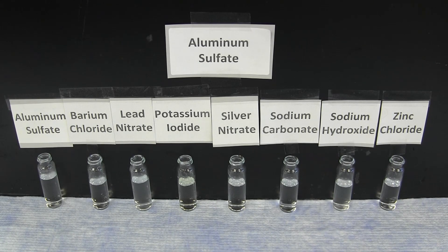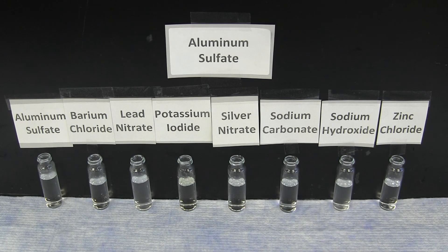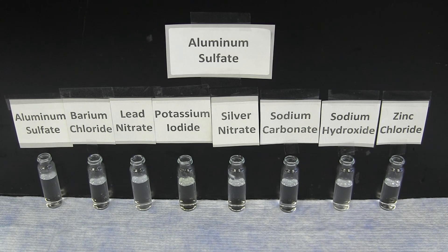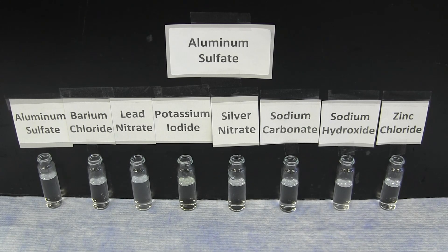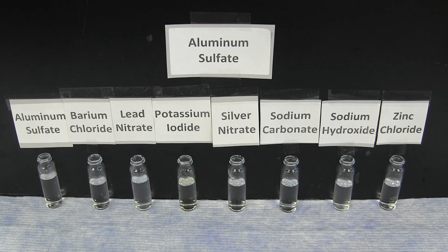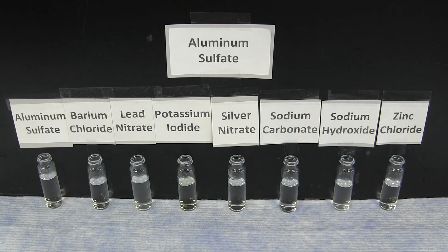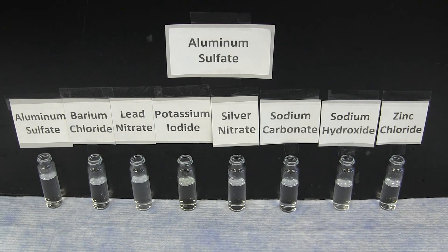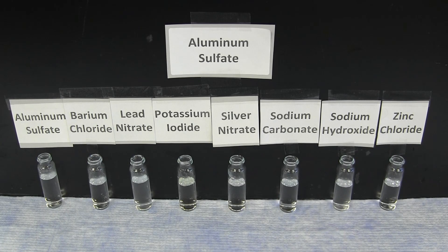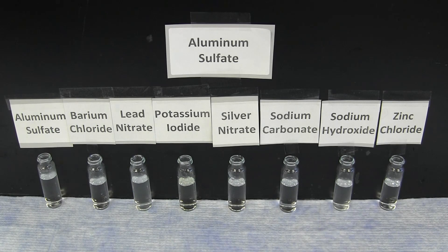After which, you will have an unknown where you will see the full reaction pattern of eight unlabeled solutions. These solutions are the aluminum sulfate through zinc chloride solutions that are shown already. You will be determining, based on the observations of your unknown and looking at the different patterns, what is the identity of each of your eight solutions.